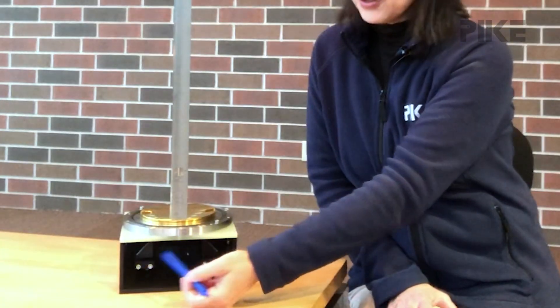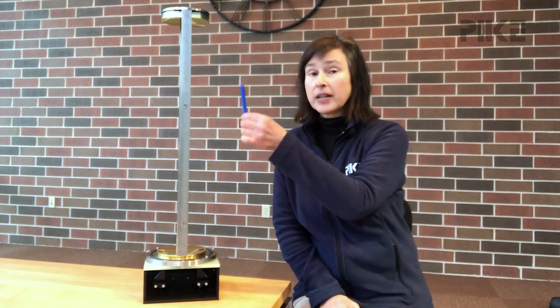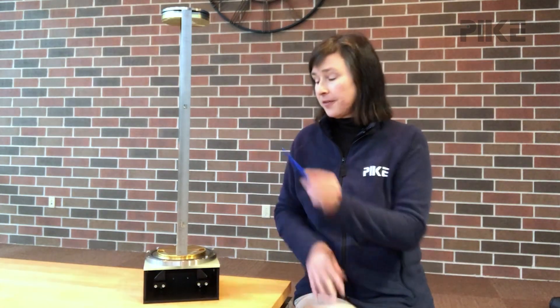For your tip this week let's talk about aligning a gas cell once you receive it. I have a shell of a 30 meter gas cell. Down below there are two flat mirrors. The beam comes in, hits a flat mirror, and is directed to a mirror up above and a mirror below.